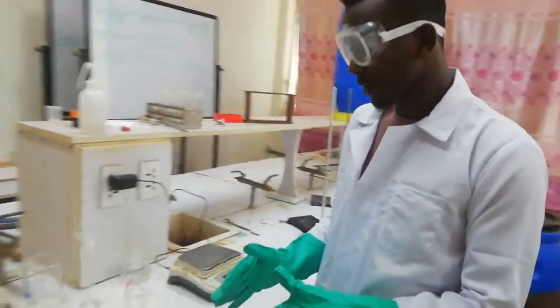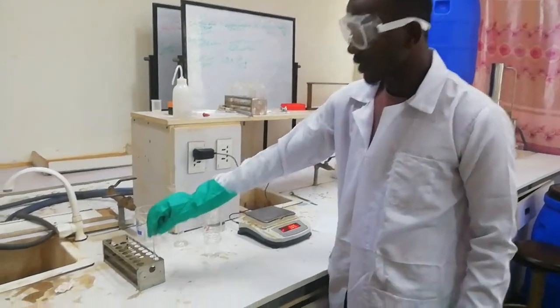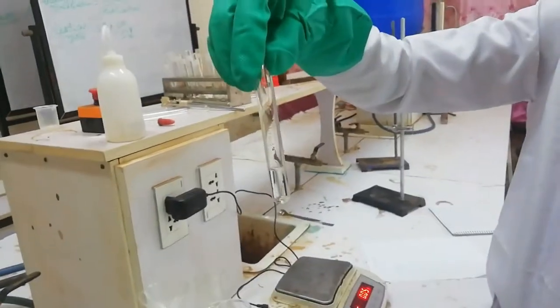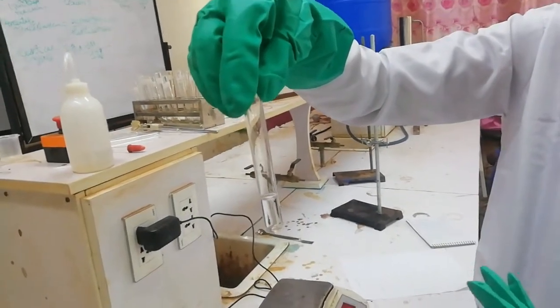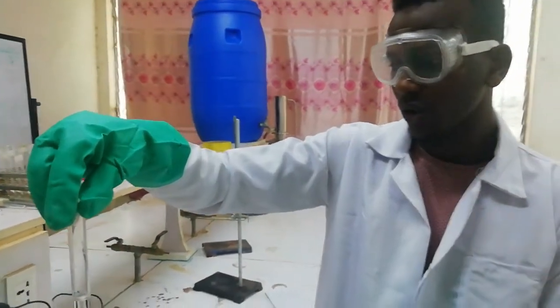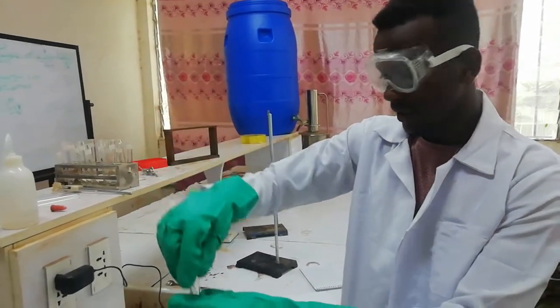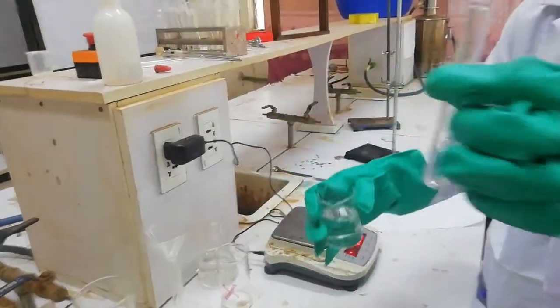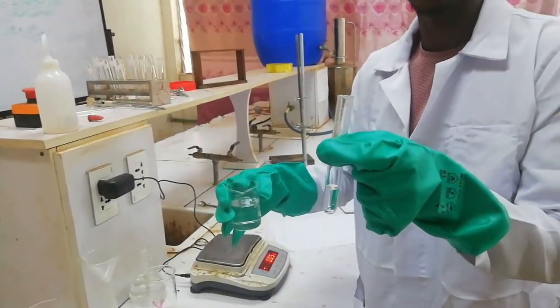We are going to see the solubility of your unknown solute. This is your unknown substance — unknown liquid X. If you want to know this substance, you can calculate its density and you can measure its boiling point, then you can identify this unknown substance. So we are going to check whether your unknown substance is soluble or insoluble in tap water.